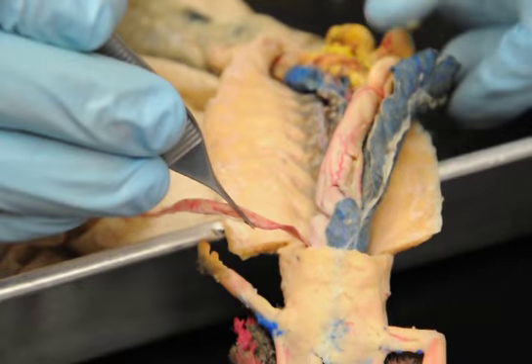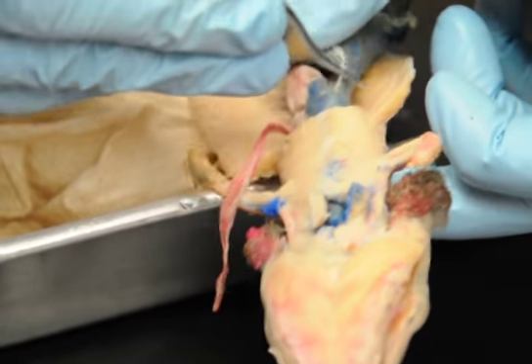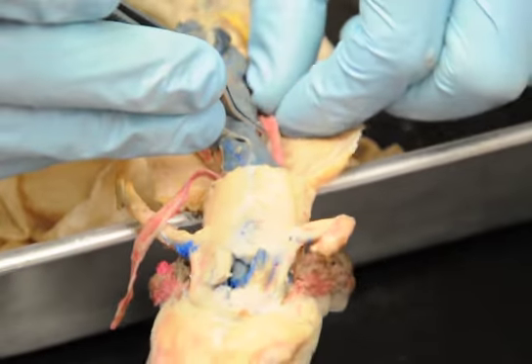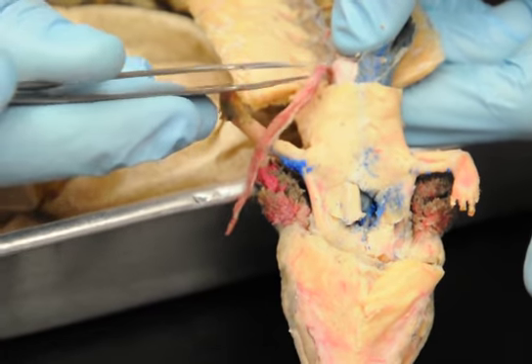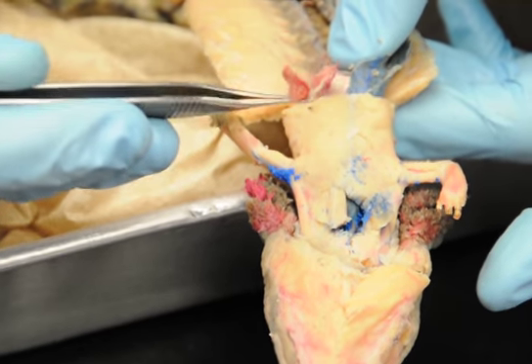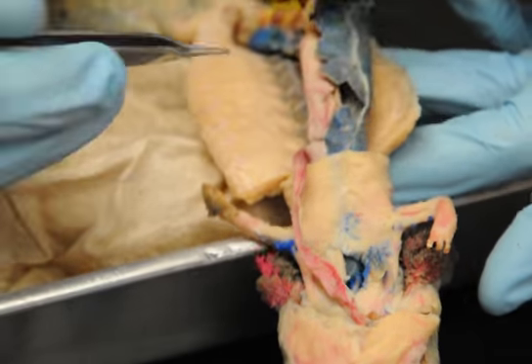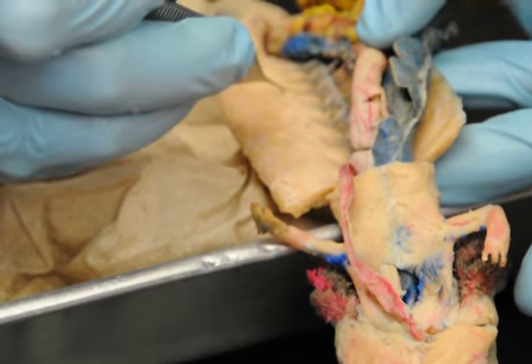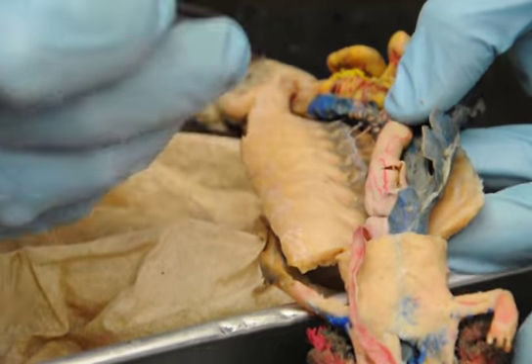Don't forget in your lung system, whether it's the cat or the mud puppy, deoxygenated and oxygenated blood switch between arteries and veins. So if you see a red vessel running through your artery in the lung, it's a vein. If you see a blue vessel, it's an artery, only in the lungs. Same with the cats. Segmental arteries are all the way up and down, these little short pieces here.